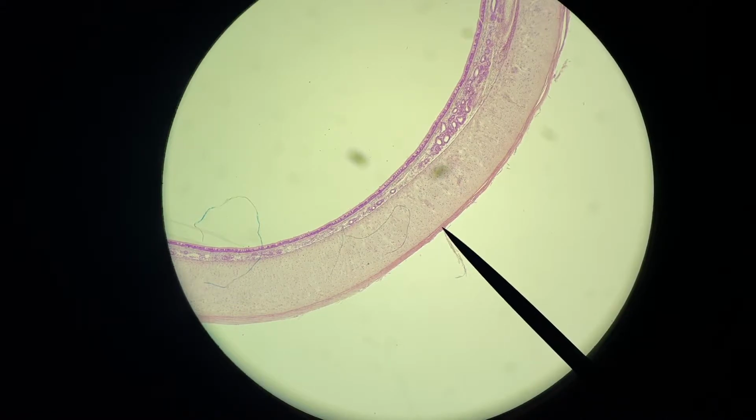If you look at this, we're in our largest field of view because we're set at the lowest power. And there's two reasons why you want to always start at the lowest power. One, to ensure that you don't crash the slide into your lens and damage both, which could be very expensive. And then two, it gives you the largest field of view. It makes it the easiest to acquire your tissue sample. So that's what we're seeing here. Our tissue sample at the lowest power provided the largest field of view.